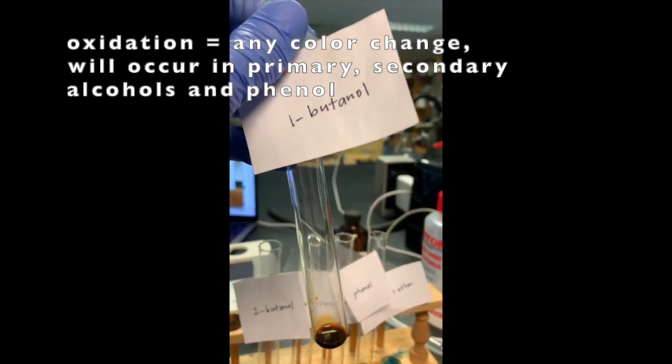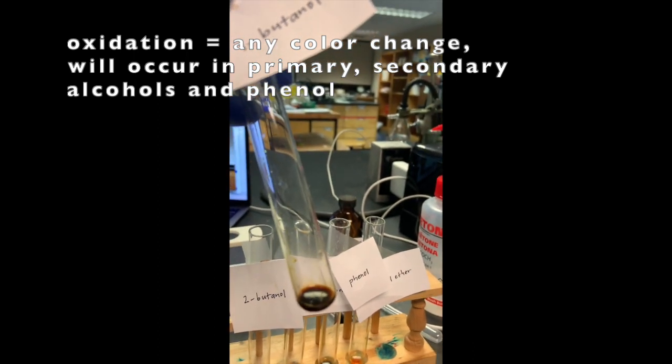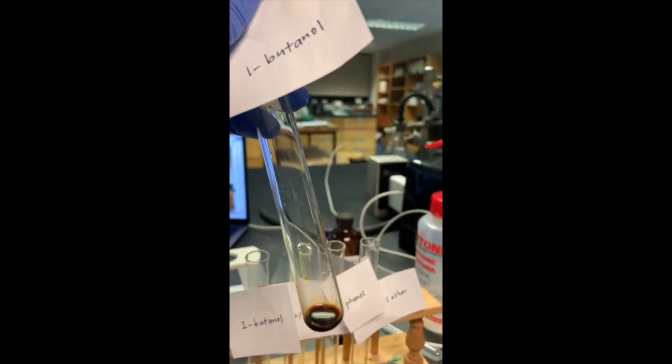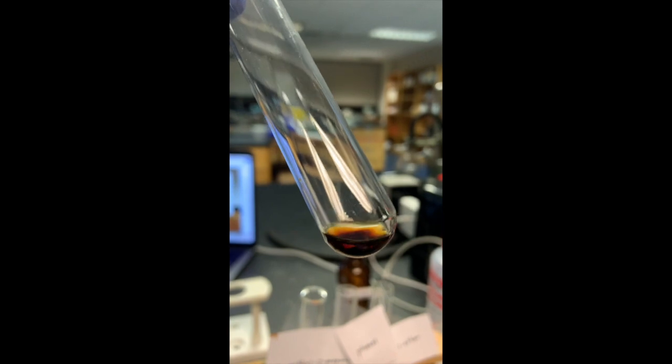Initially the 1-butanol was clear and I added that orange chromic acid. So if no reaction took place, it would just be an orange color. So we did see a reaction there. 2-butanol is the same.